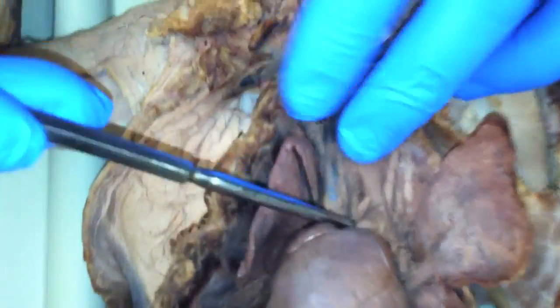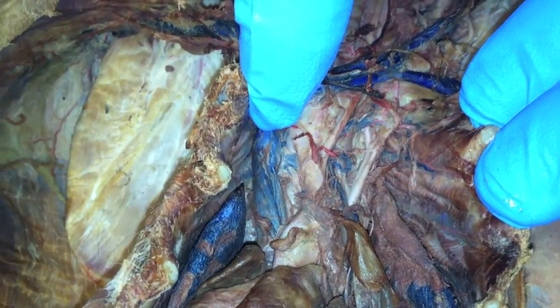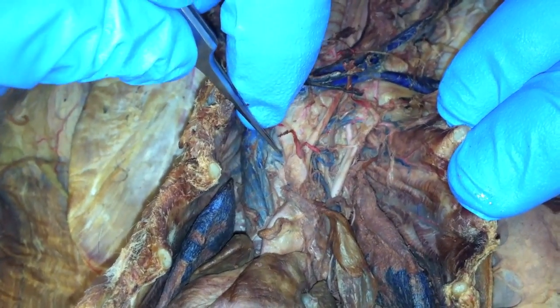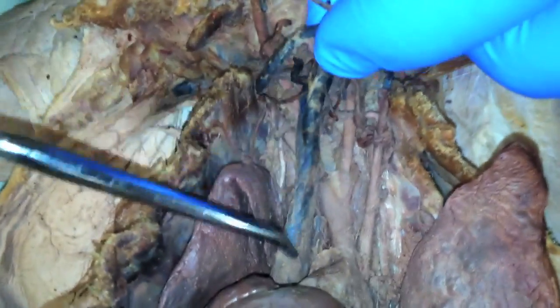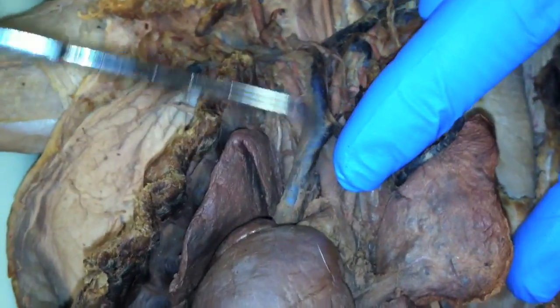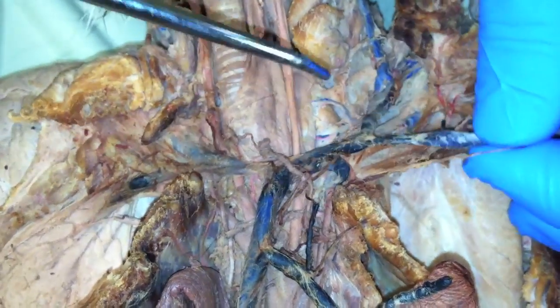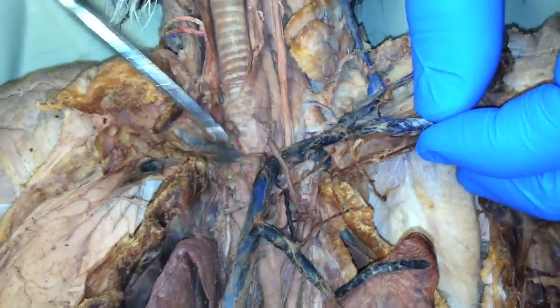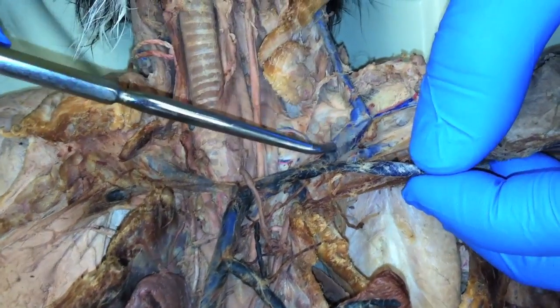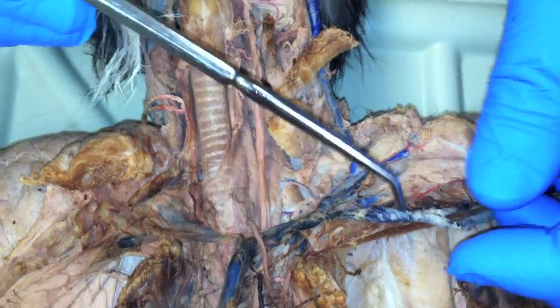This is the azygous — this is the first branch off of the anterior vena cava. So here we have our anterior vena cava. This is the internal mammary. And the anterior vena cava continues up into the external jugulars and into the subclavians. External jugular, subclavian.